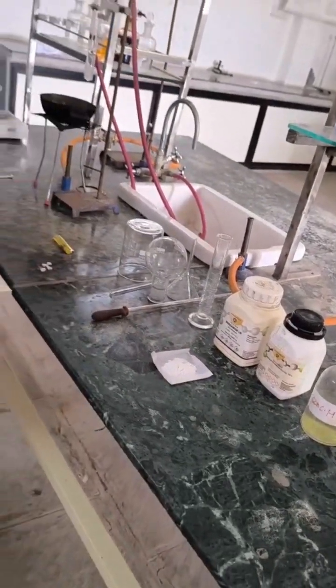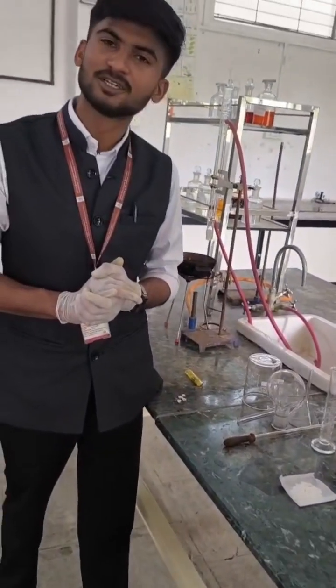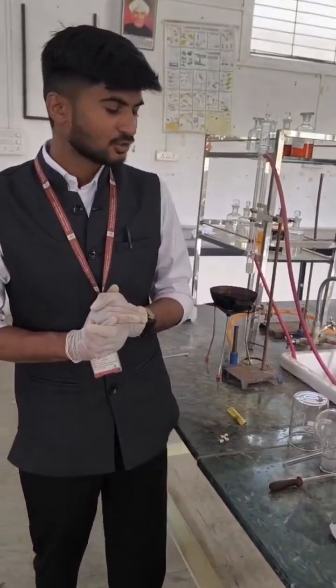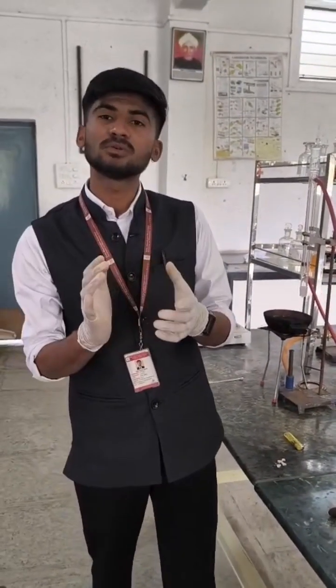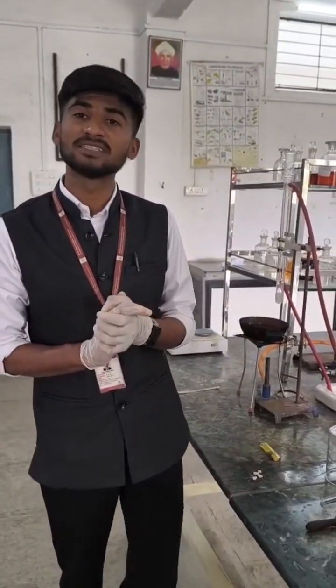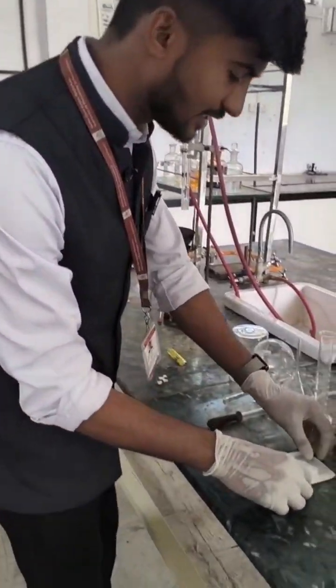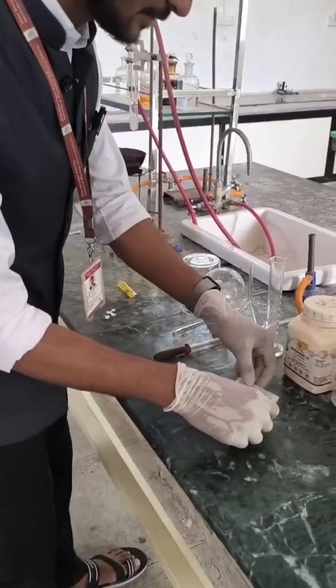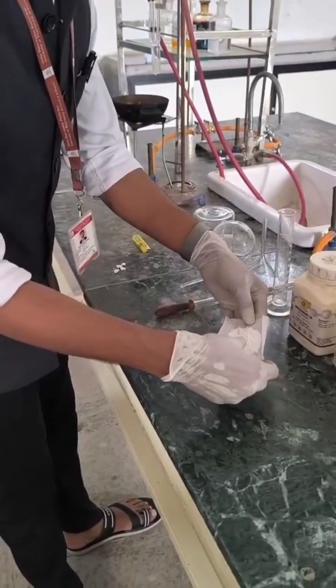Now we are going to proceed with the procedure. The first step is to weigh 5g of benzamide. I have already pre-weighed 5g of benzamide.